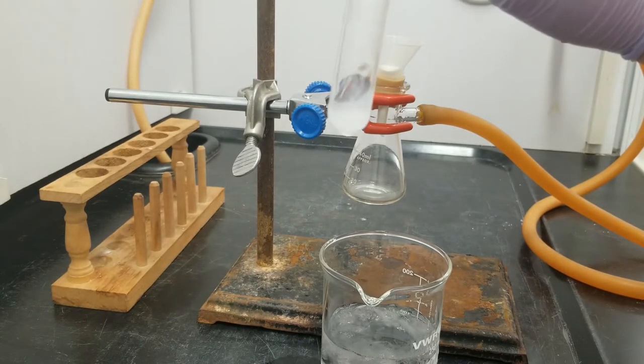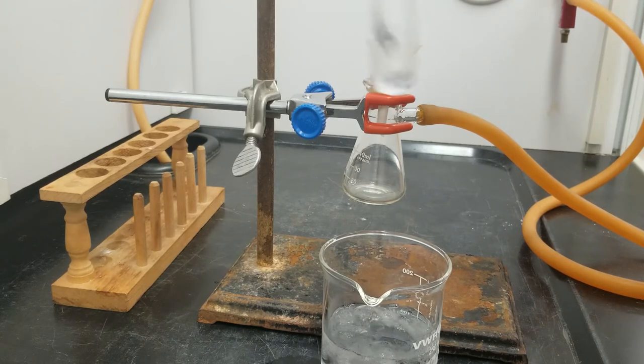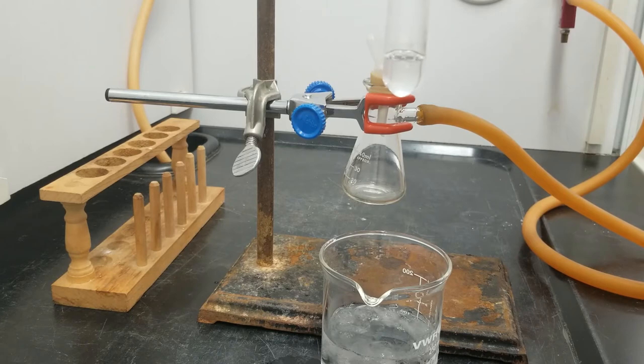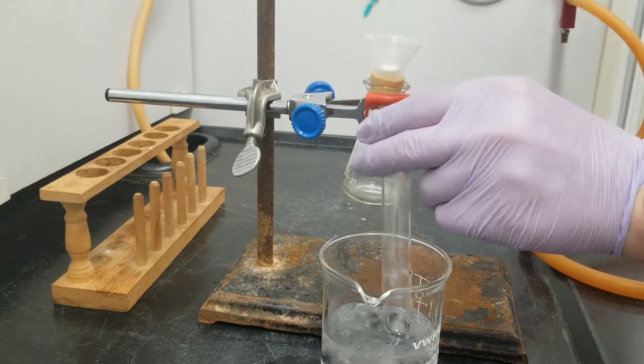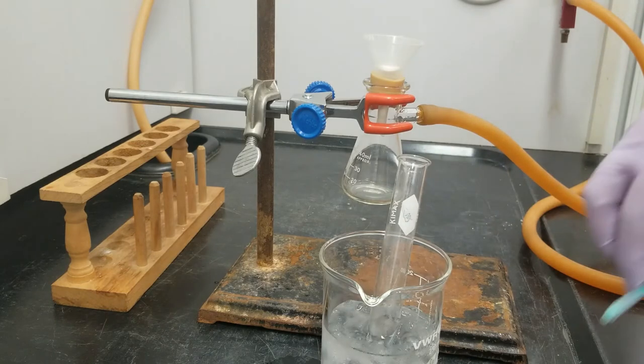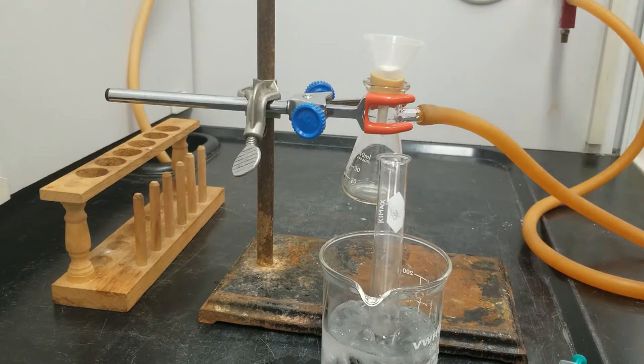And I want that solution to get nice and cloudy. So I see a couple little solids floating around. Let's put that back on ice for a moment and come back once we see solids.